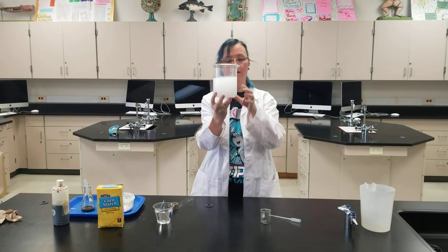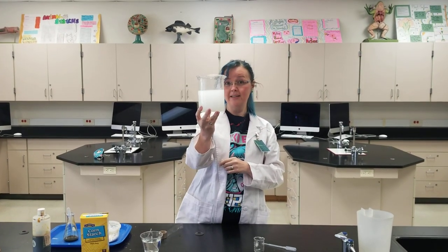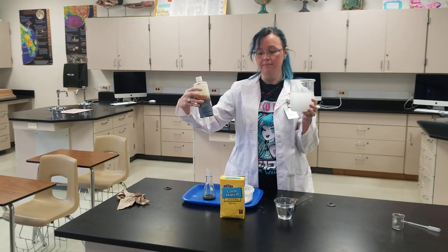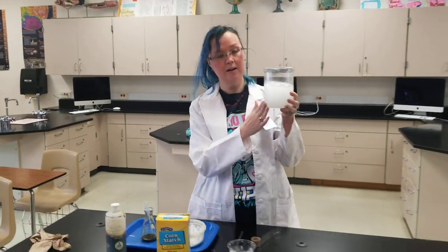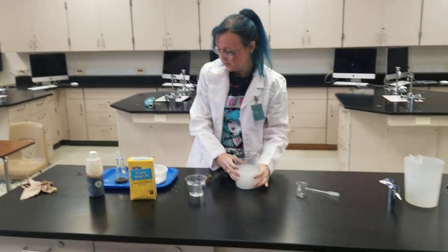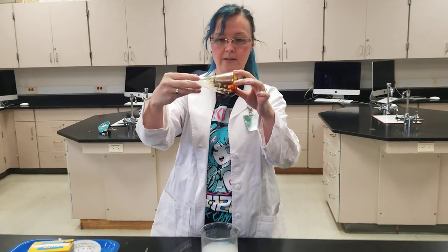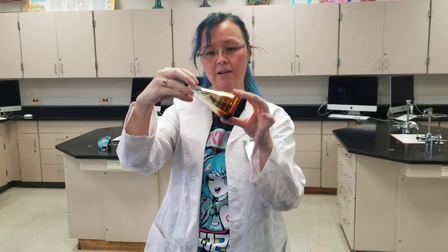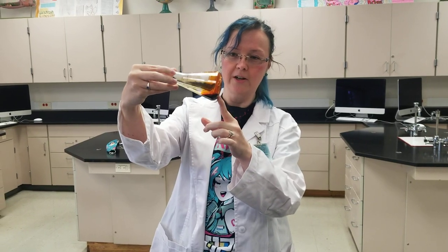First off, I want you to pay attention to the current color. What we're doing today is we're using something called an indicator solution. Our indicator solution is going to be iodine. Iodine is going to help us to indicate the presence of starch. So pay attention to the color that this is now, and I want you to pay attention to the color of the iodine. Iodine is typically used as an antiseptic — at hospitals, if you've ever had surgery or had stitches, you've seen the color that this is. It's kind of a reddish-orange color.